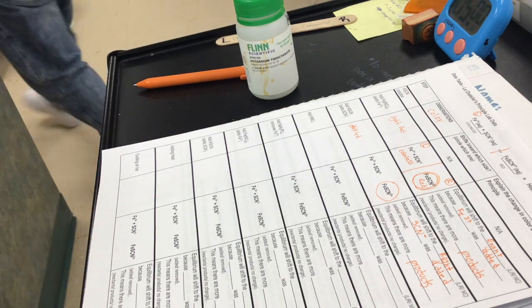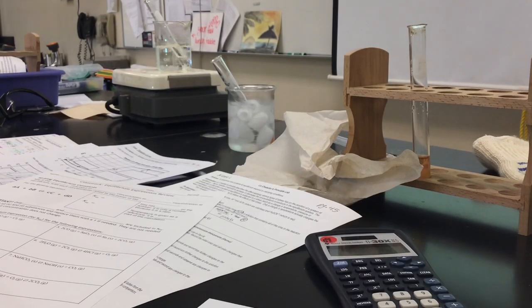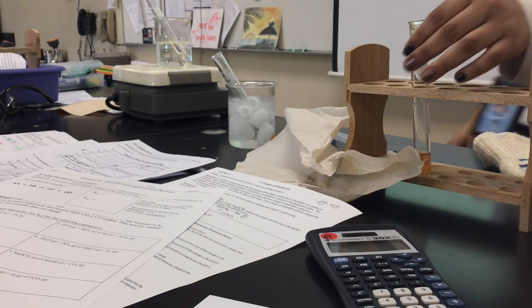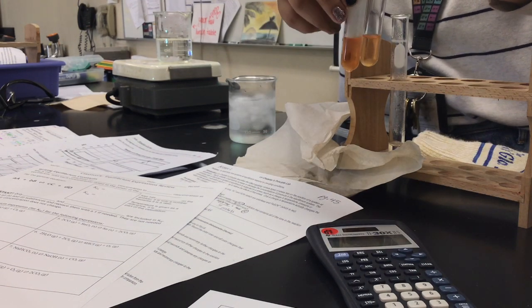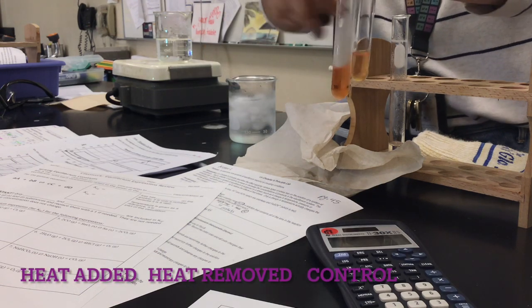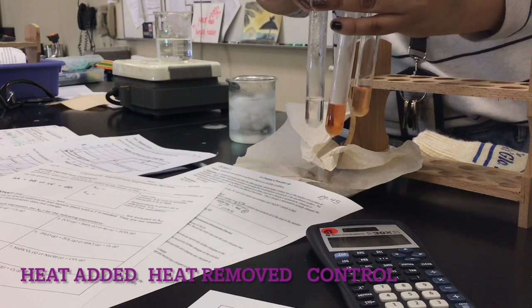And I'm gonna go pipette some of this out and get some ice. Okay, so can I have your eyes on me again? Your pencil's out of lead? Sorry. Okay, this one is without heat, so heat is removed. Now heat is added. Okay, good.